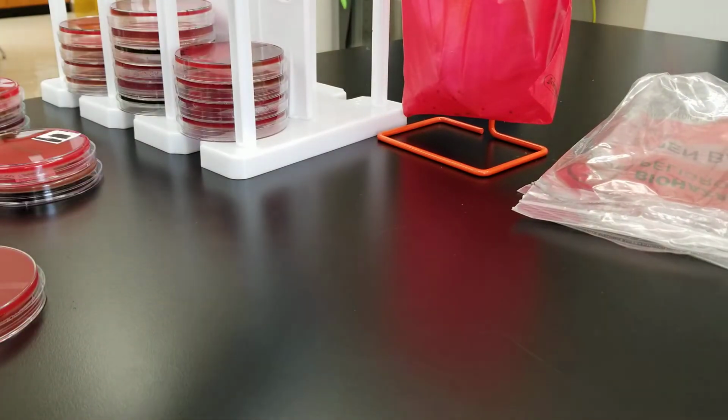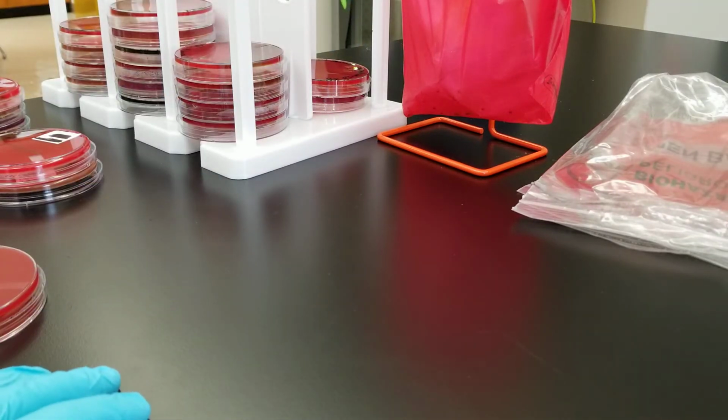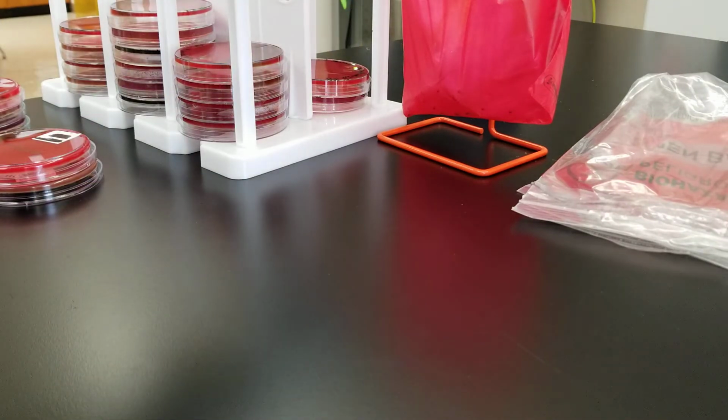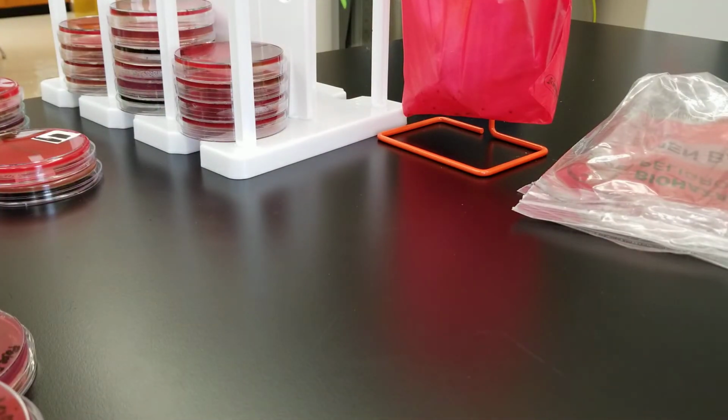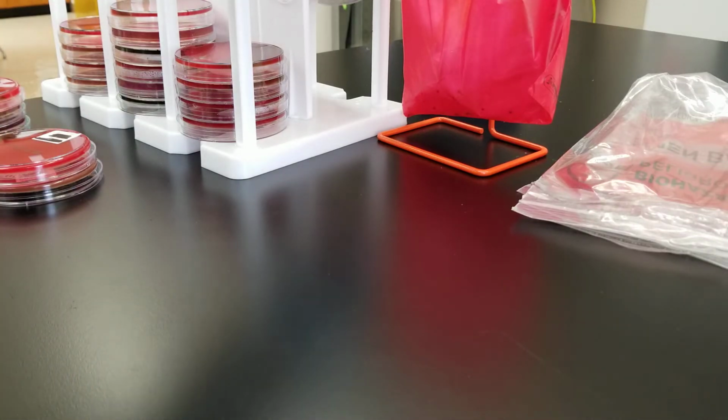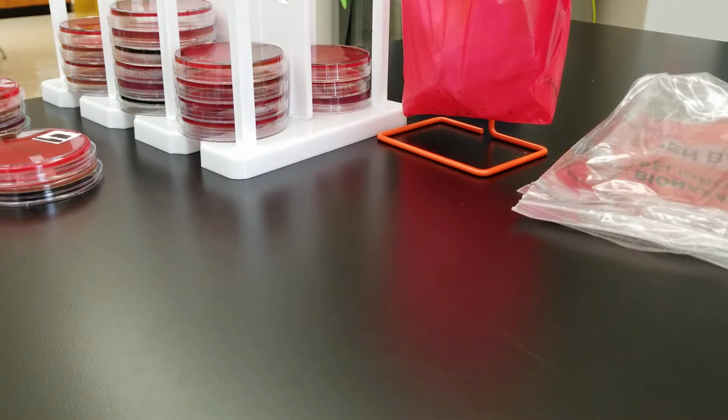Okay, so the whole point is when you're collecting from a body site, you want to make sure not to touch any of the area surrounding that you're not trying to get a culture from, because everywhere in you and on you has normal microbes that keep you healthy from the pathogens that might try to come in there and harm you and cause disease. So that's why we are doing these videos, and that's why we're doing this lab.